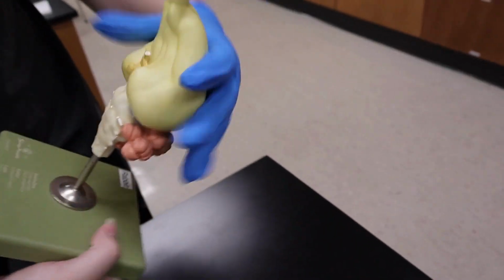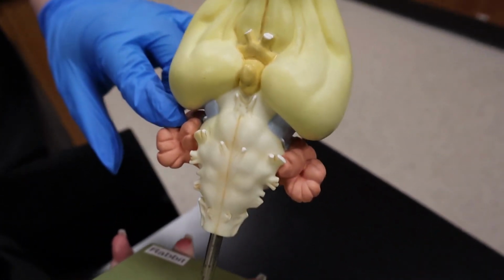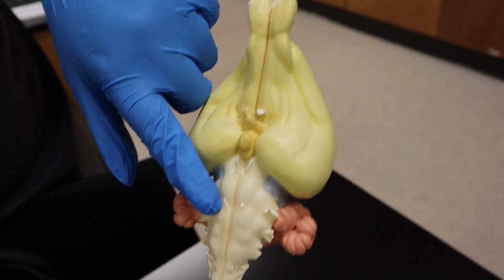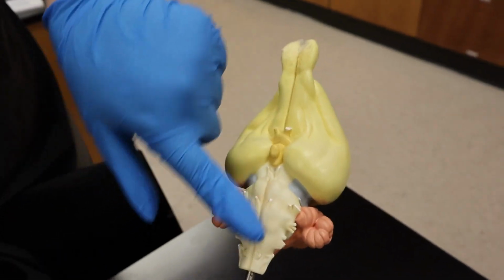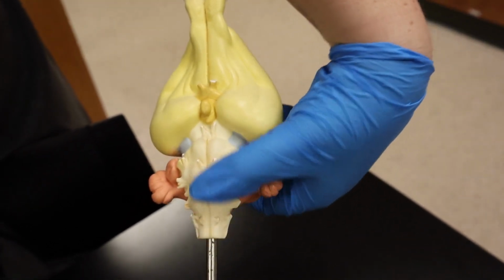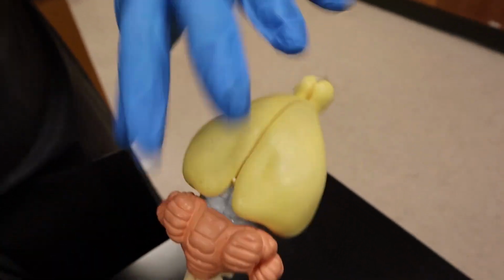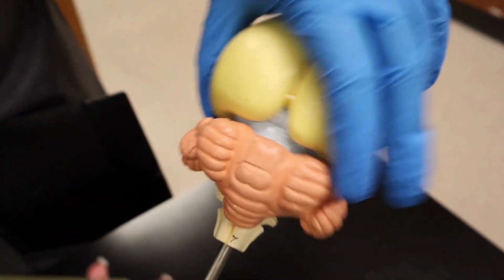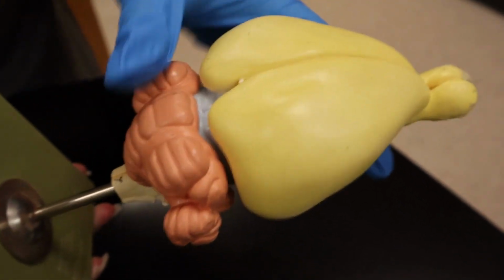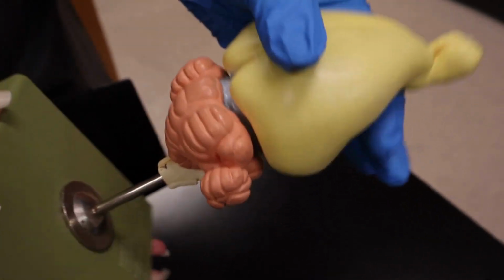Okay, so we have this cream color right here, which is going to be our medulla oblongata. It is part of the brainstem and has automatic functions like digestion, breathing, heart rate, as well as blood vessel activity. So that's what the medulla oblongata is going to be responsible for in the rabbit. Right, and so then we have our peach color right here. This is going to be the cerebellum. It's going to be for coordination, balance, as well as motor skills. These are very essential in avoiding predation in the rabbits.